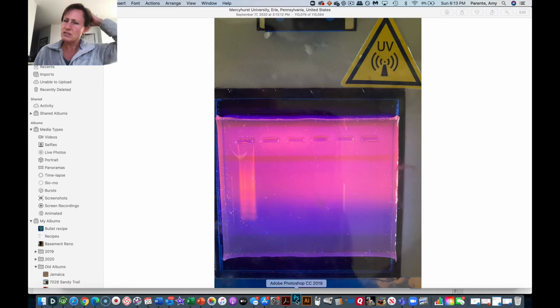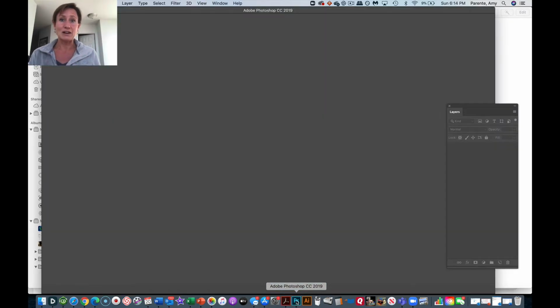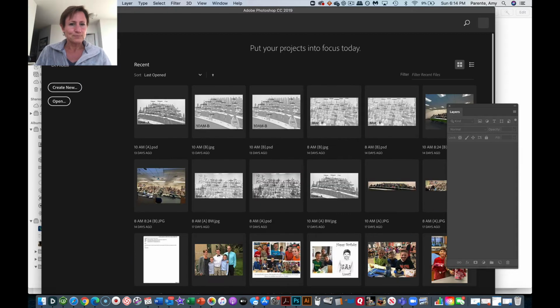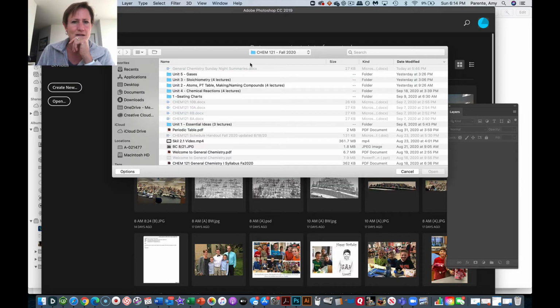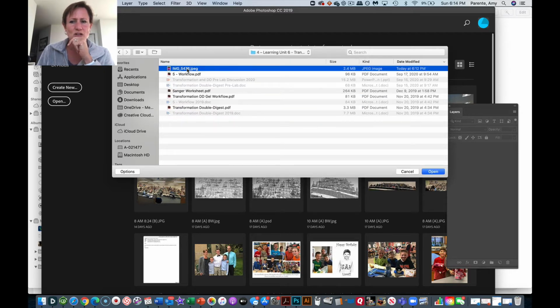I don't know if students have access, as Mercyhurst students, to the full Creative Adobe suite. If you do, I would definitely recommend downloading it to your computer. It's a great suite of programs to have to do a lot of different things. All right, so let's go ahead and open up this file. I just saved it as a JPEG here.